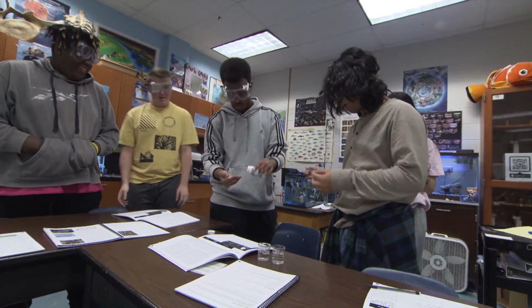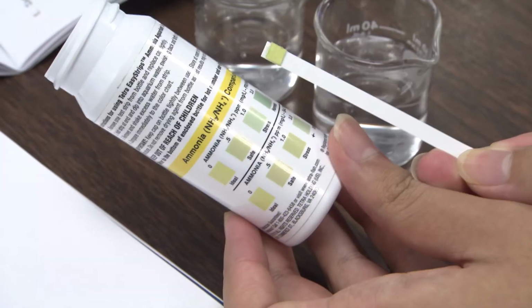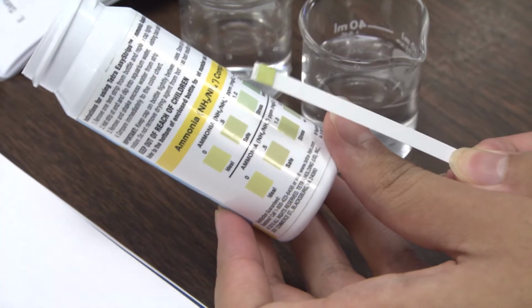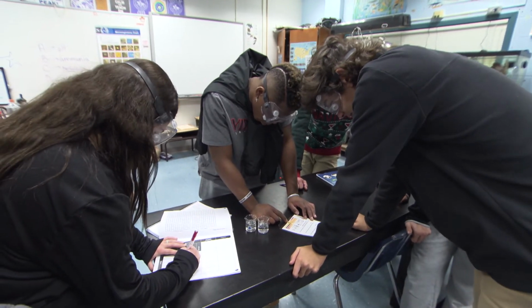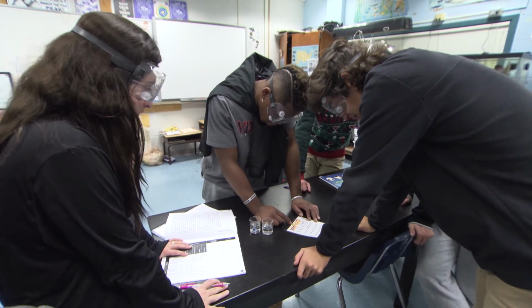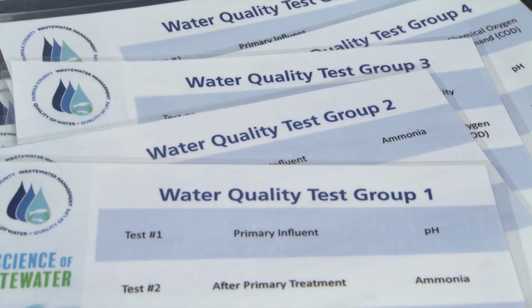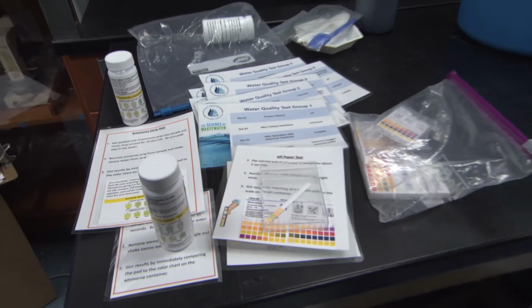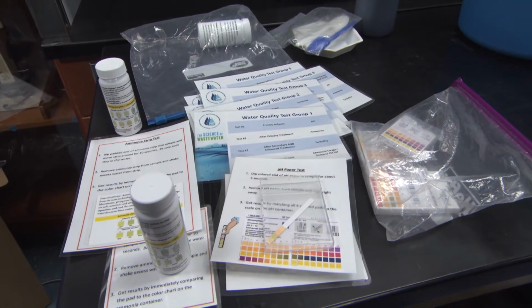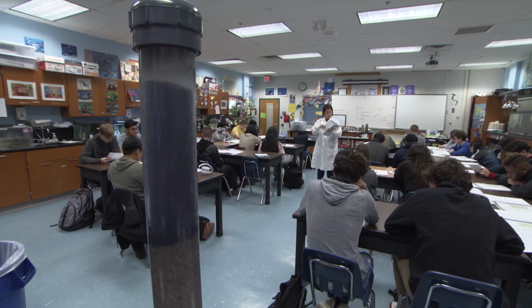Have the students hypothesize the pH, ammonia, turbidity, and COD as a result of final treatment. Then have students perform test 4, clean up testing stations and discuss data. Include a discussion about how treated wastewater is released back into the environment via our rivers and streams. Connect the final data with the EPA requirements that need to be met to discharge treated wastewater, final effluent, into sensitive bays or rivers. Did you meet the requirement?